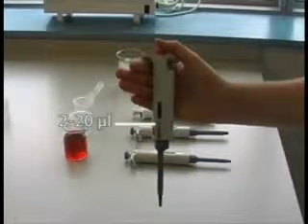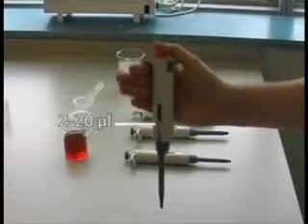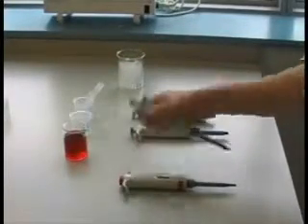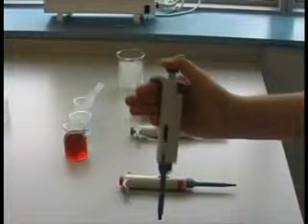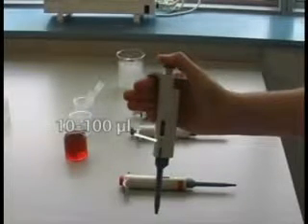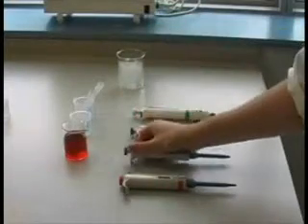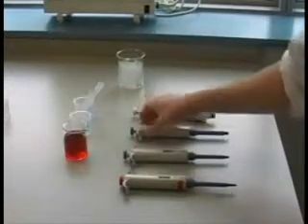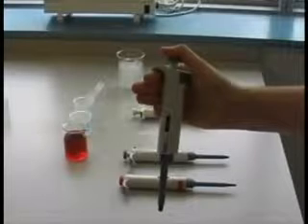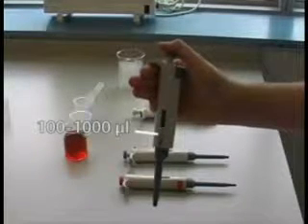Pipettes come in different sizes. The arrows show minimum and maximum volume ranges for specific pipettes: from 2 to 20 microliters, 10 to 100 microliters, 100 to 1000 microliters, and finally 1 to 5 milliliters. It is important to select the correct pipette for the volume of liquid you wish to measure, because selection of the correct size is absolutely essential for making accurate measurements.